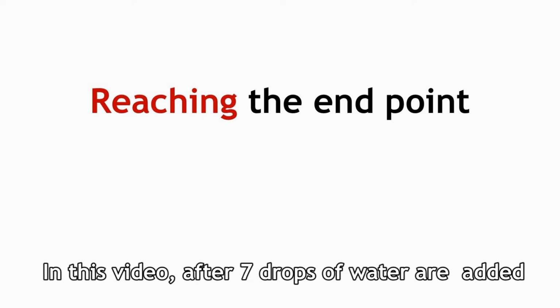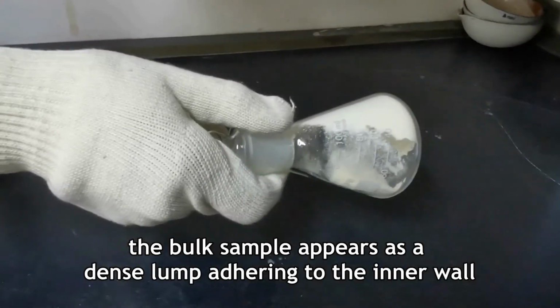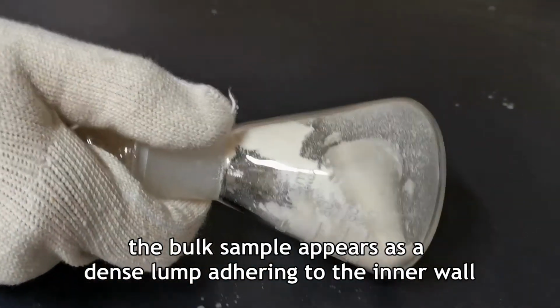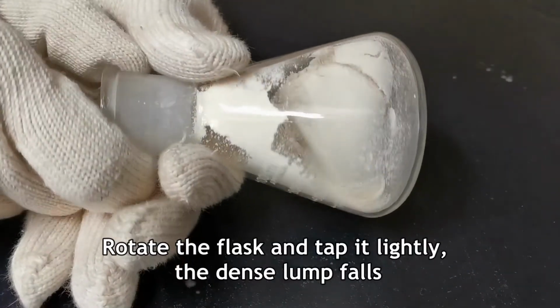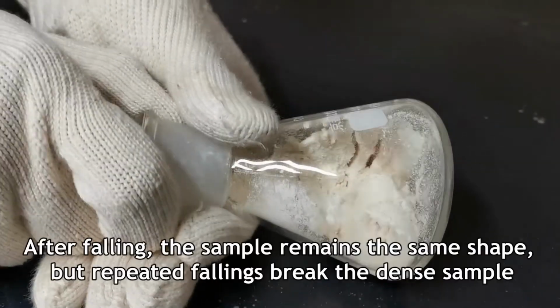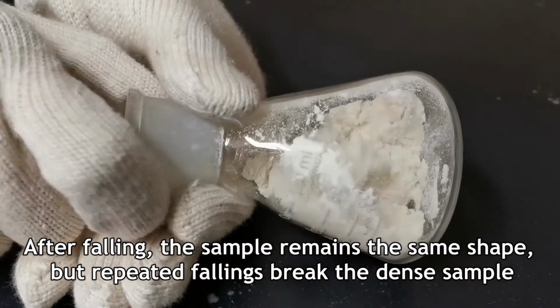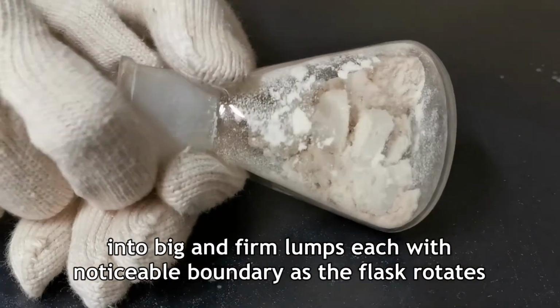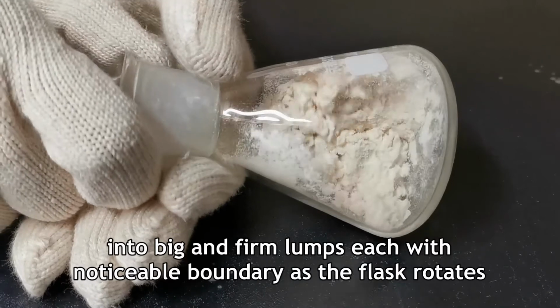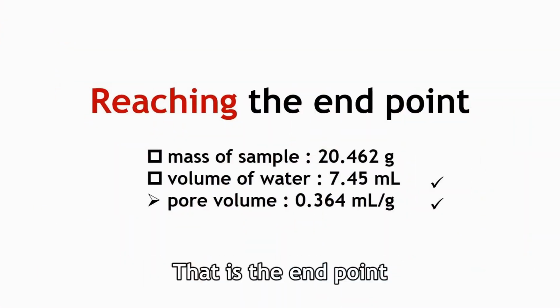In this video, after 7 drops of water are added, the bulk sample appears as a dense lump adhering to the inner wall. Rotate the flask and tap it lightly. The dense lump falls. After falling, the sample remains the same shape, but repeated fallings break the dense sample into big and firm lumps, each with noticeable boundary as the flask rotates. That is the end point.